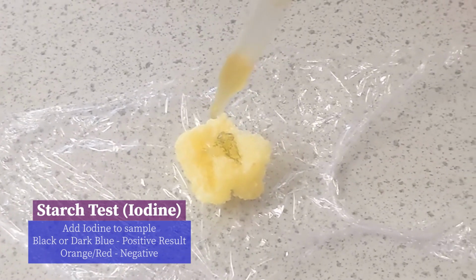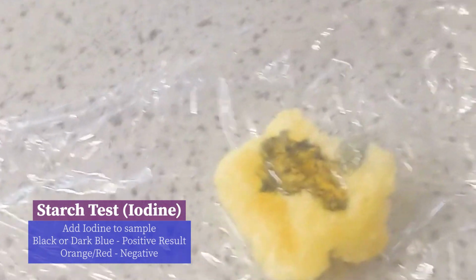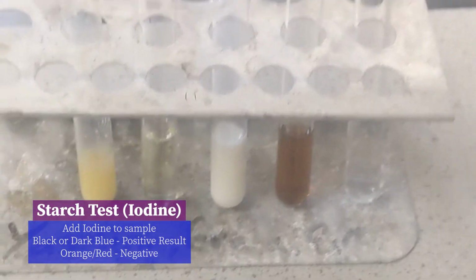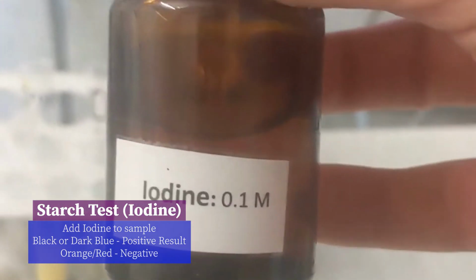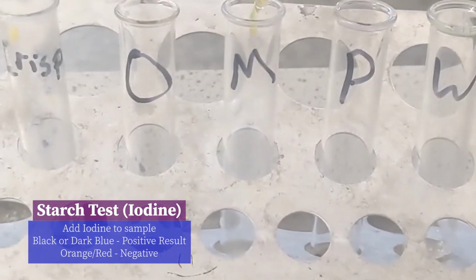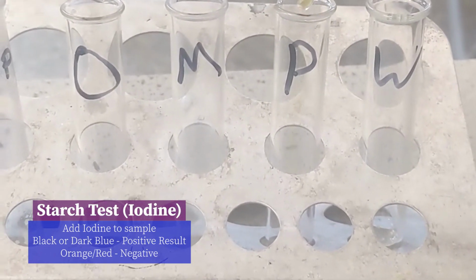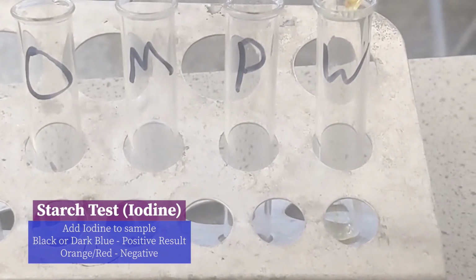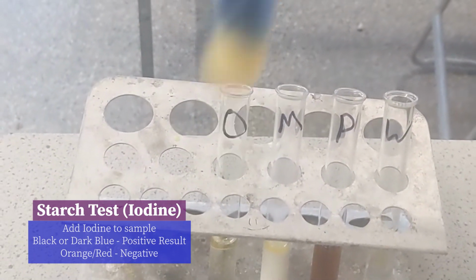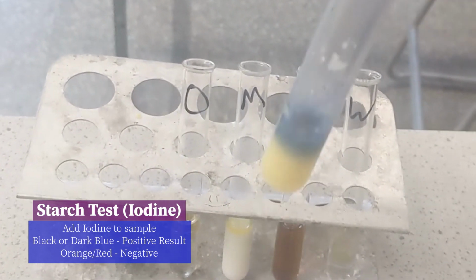Right? Now, as we see, very simple test. All we have to do is add it directly to the substance and it can tell us this. Or if we're testing something inside a test tube, we just mix the solution up, add a couple drops of iodine to it, swirl it gently, and look at it. A positive result will be black or dark purple, and a negative result will be an orange brownish color.